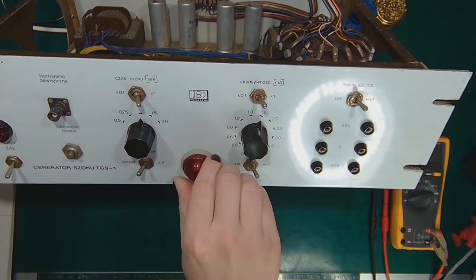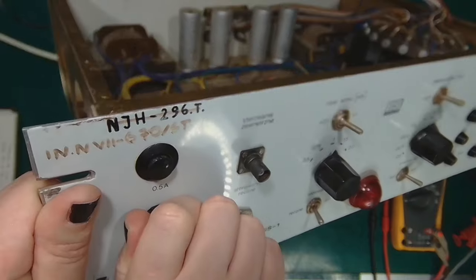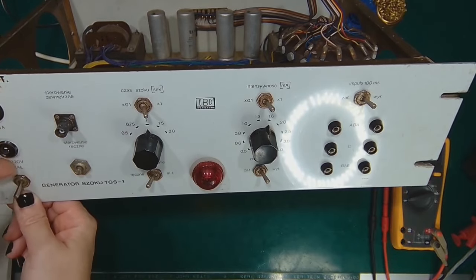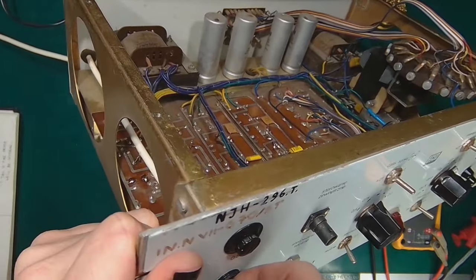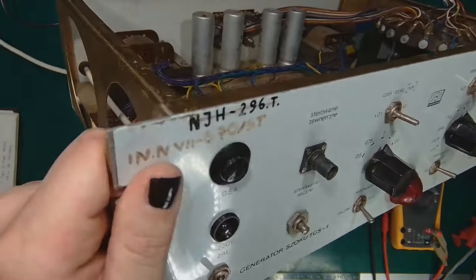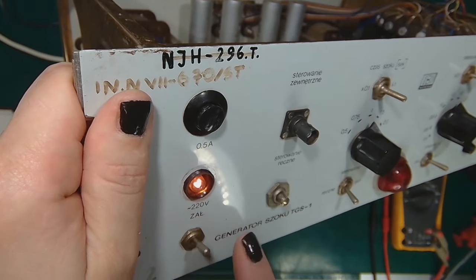The other indicator lamp uses a typical low voltage light bulb. Of course, I have to do it with my left hand. This is tighter than ever. But it comes up pretty nicely.